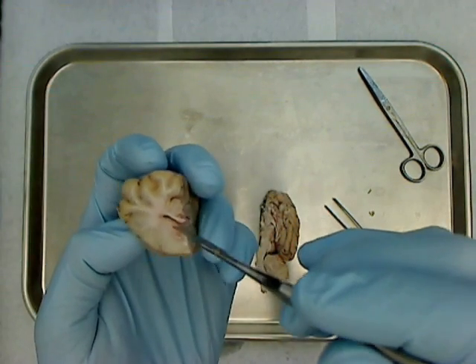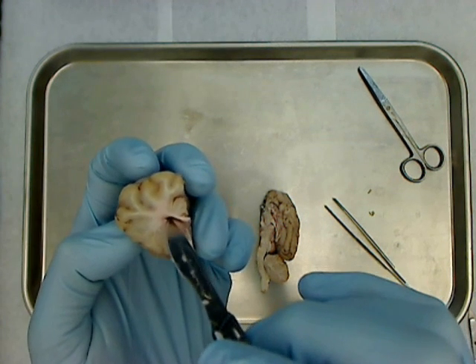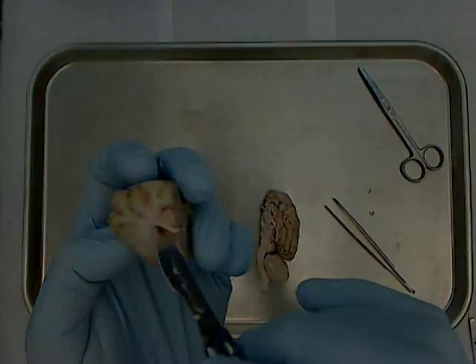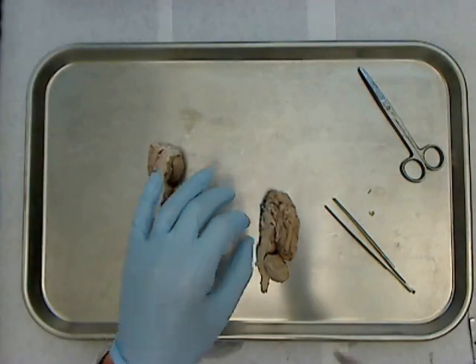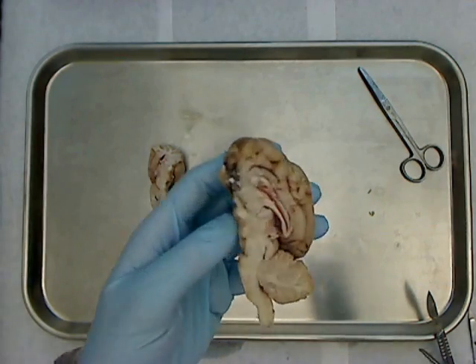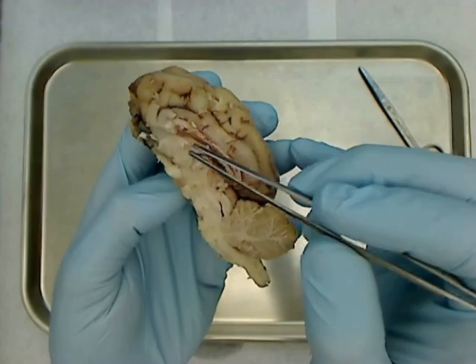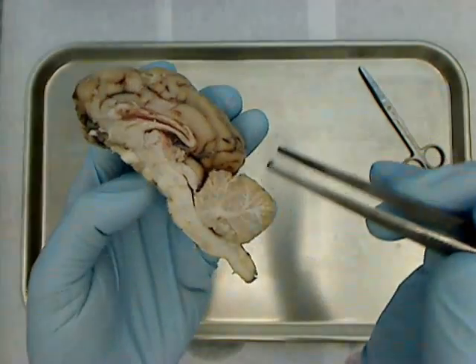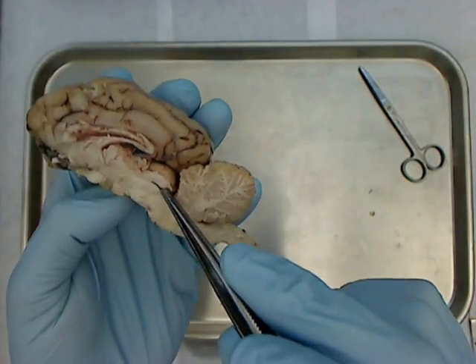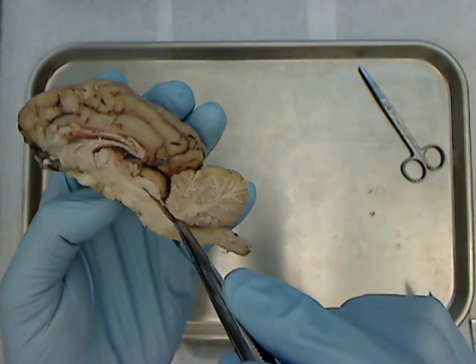Also on this brain I have, in this case, the left lateral ventricle. The other ventricles on the sheep brain: if we're up here, that would be the third ventricle. If we're down here in front of the cerebellum, you can see this open area here — that's the fourth ventricle.